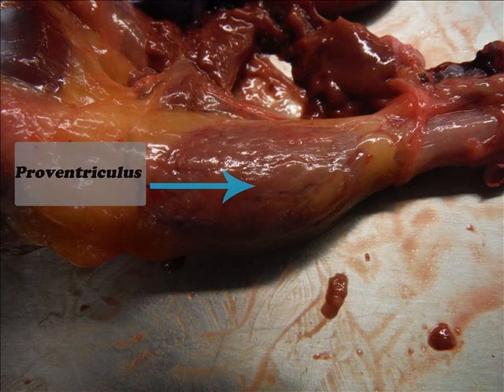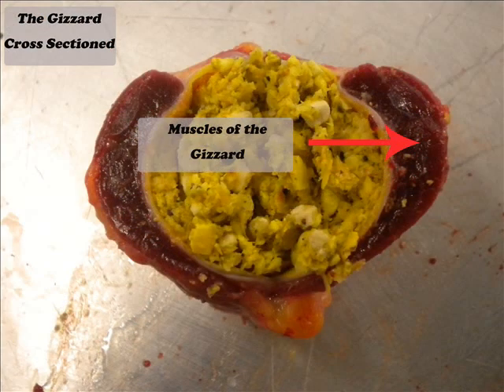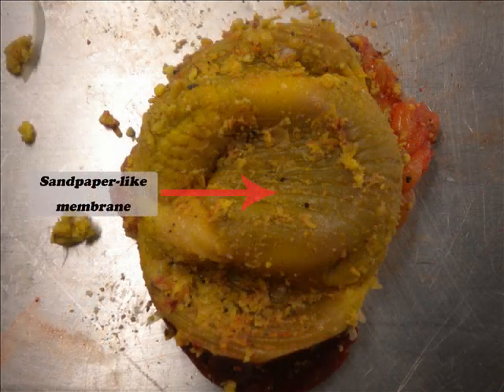For chickens, the proventriculus, also known as the glandular stomach, is the true stomach and is small and tubular. In the proventriculus is where digestion occurs with the addition of hydrochloric acid and digestive enzymes. Also known as the ventriculus, the gizzard is a muscular organ that is a part of the stomach. With a strong contraction of muscles in the presence of grit, it grinds grains and fiber into smaller, more digestible particles. It also has a thick muscular wall with a sandpaper-like inner surface.